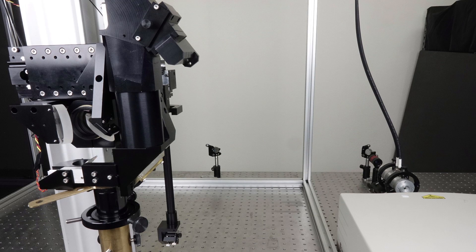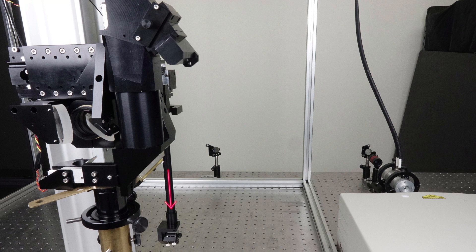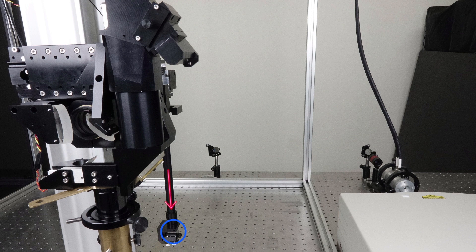At this point, with the scan mirrors sitting in their centered position, the beam should be pointing straight down the periscope tube, coming out of the center of the periscope tube, and reflecting off the mirror at the bottom of the tube across the table, toward a mirror that would direct it then towards the imaging laser.